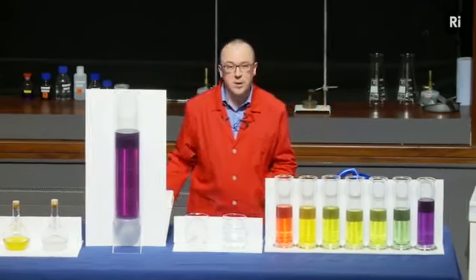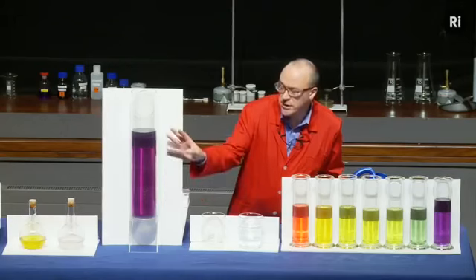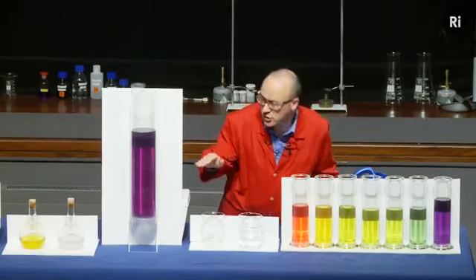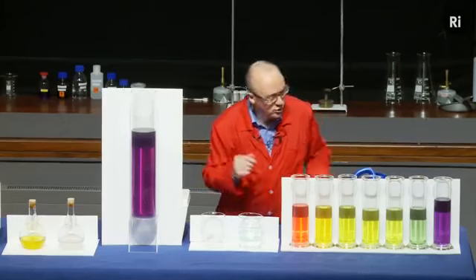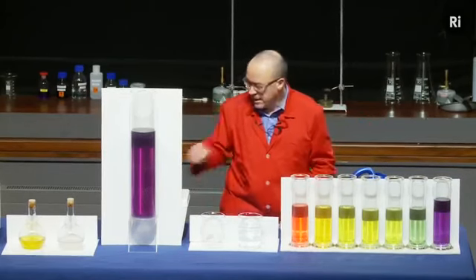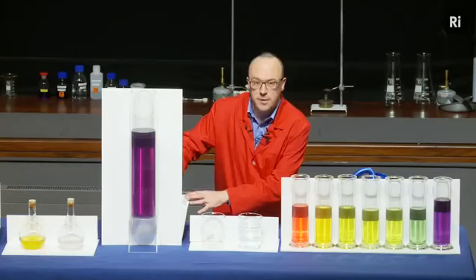But let me just show you now another example of a reaction involving universal indicator, and it's this column of water which has universal indicator and also a little bit of sodium hydroxide, which is alkaline, and so it's turned it this sort of bluey purple colour. And we're going to add some acid, and we should see it go through a sequence of colours rather like these. Now, the particular acid that I'm going to use is acid that's going to be made in the water from carbon dioxide.